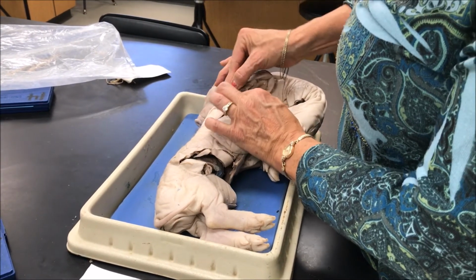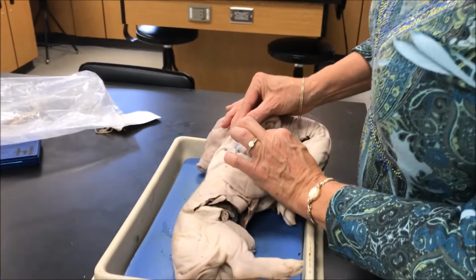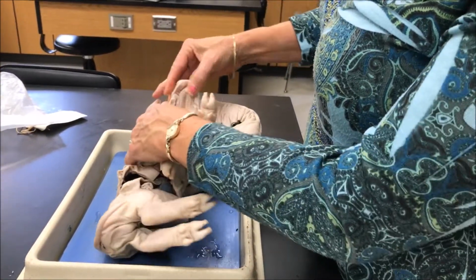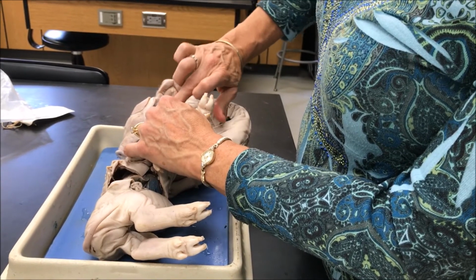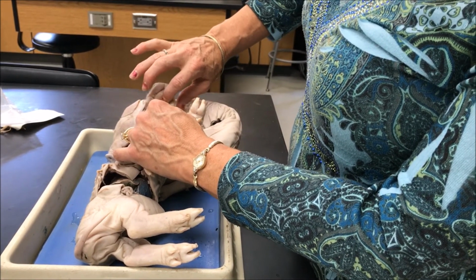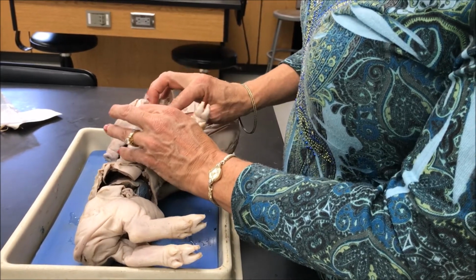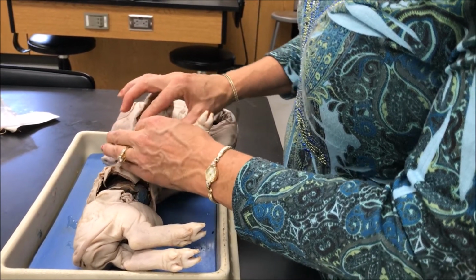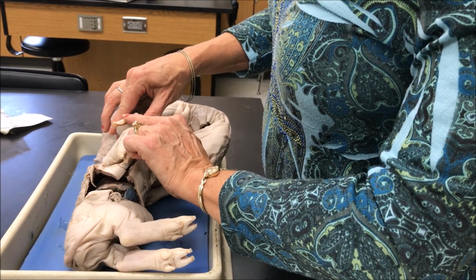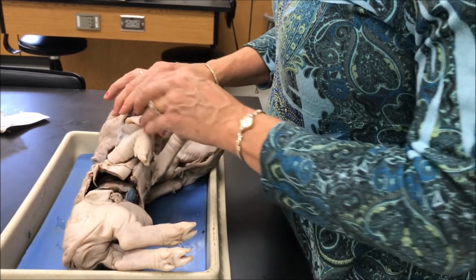All right, this gland on the side of the face is the parotid gland, and it secretes saliva, which helps with the digestive system. Inside the mouth is the hard palate with the oral rugae, which help form the food into a bolus. The tongue helps manipulate food to make the bolus. On the tongue there are the foliate papillae on the side. Get it? Foliate, like leafy. And those are for taste and texture.